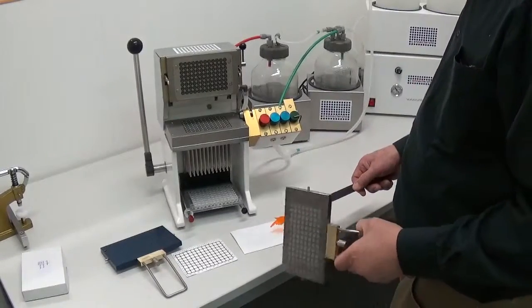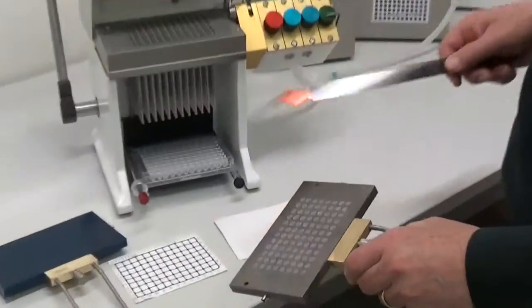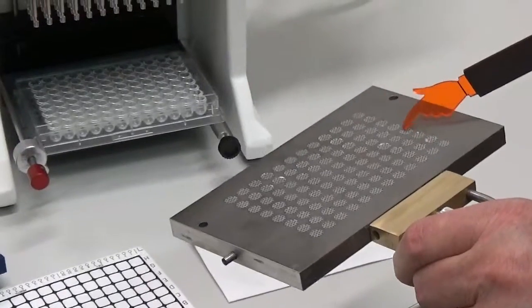For ungridded filter mats, the plate is metallic grey.